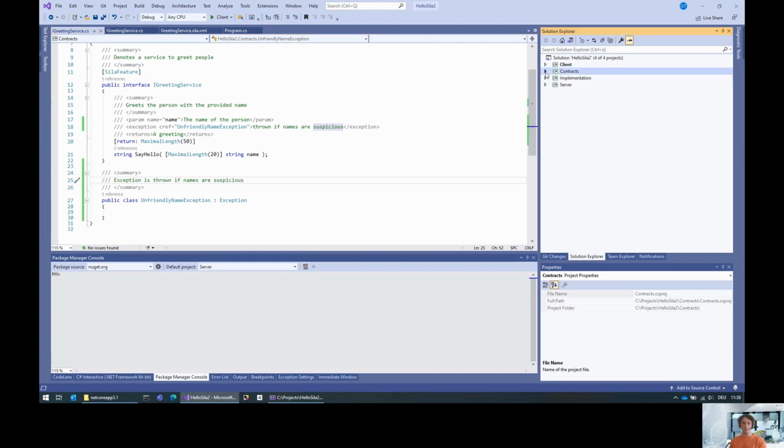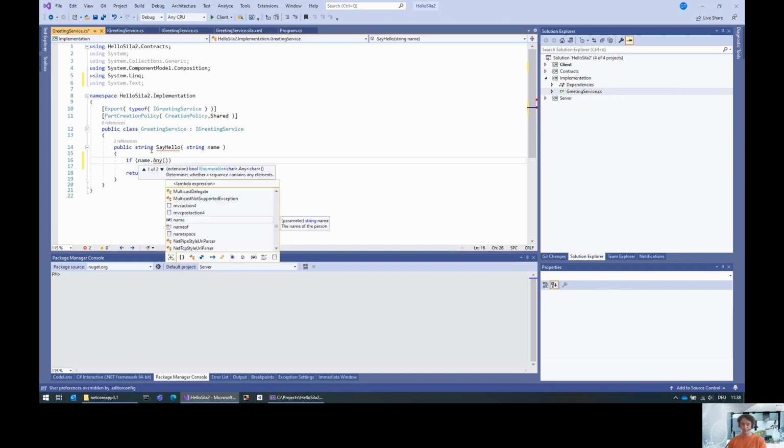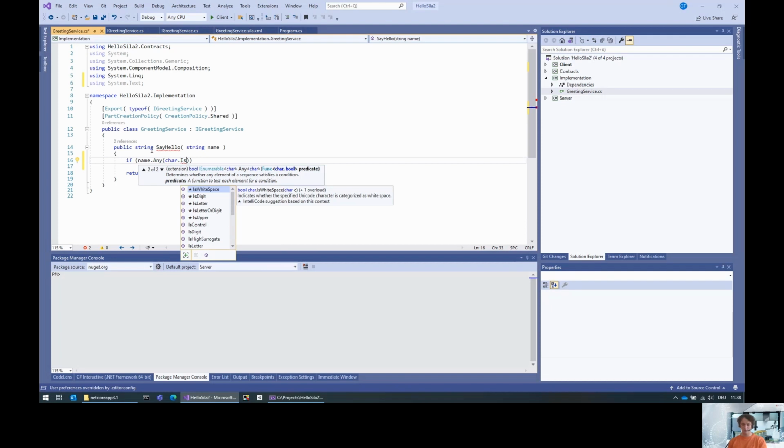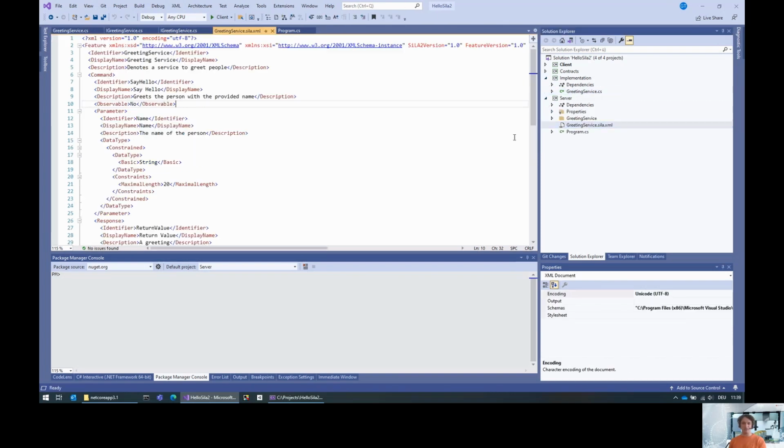Now we need to go for the implementation and implement this thing. So if name.any char digit, throw unfriendly name exception. Boom. So on and so forth. But actually, we still have the problem in the server: there's no exception information.